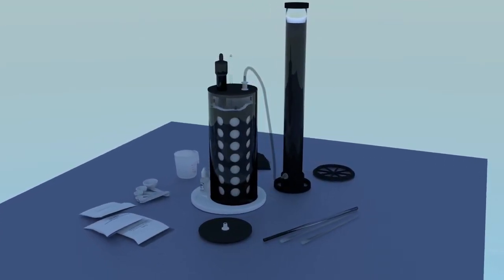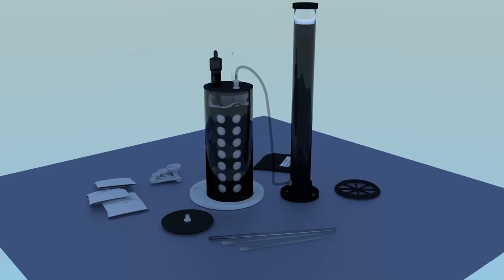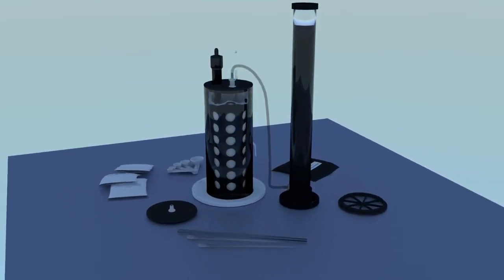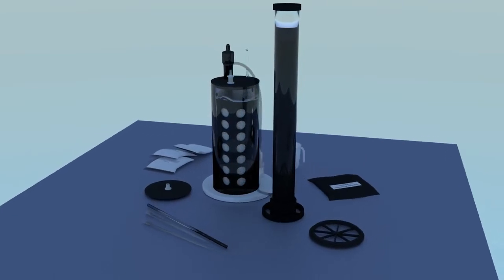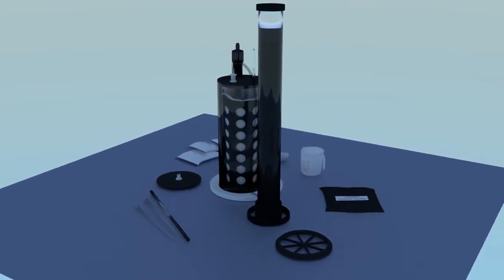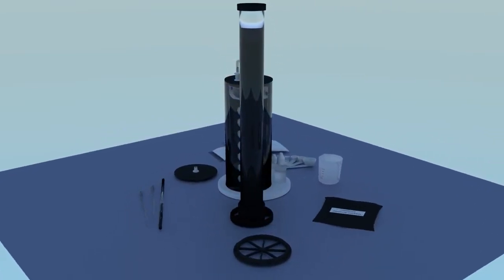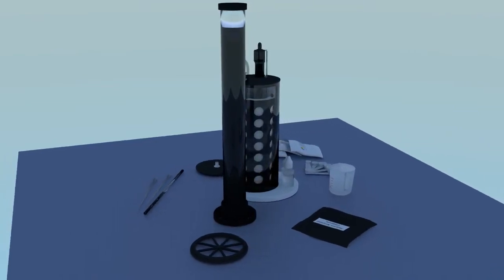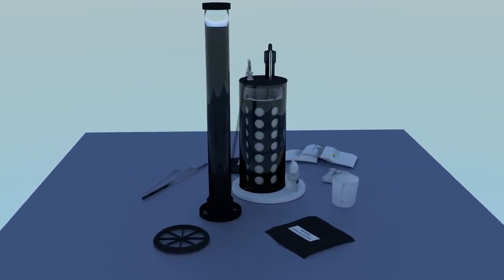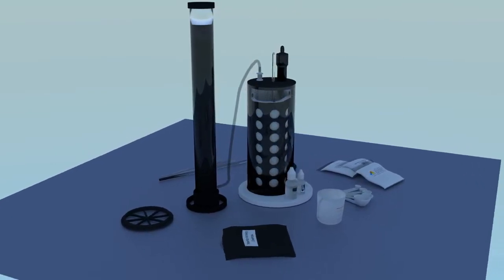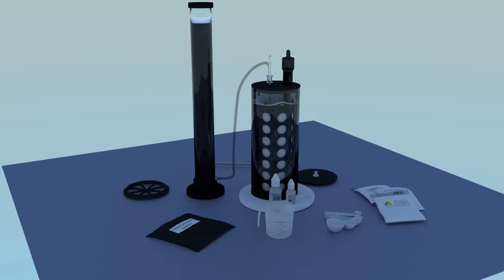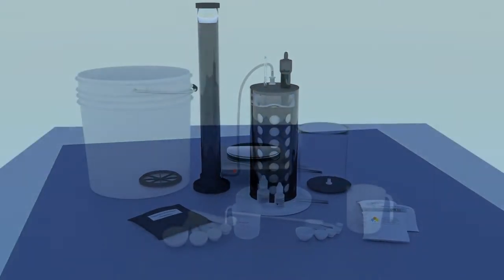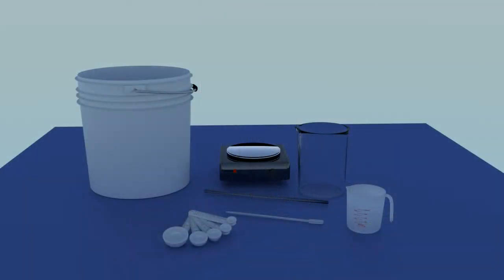Even when working with environmentally safe materials such as MX3 dissolving agent and quadratic precipitant, you must still use hydrochloric acid. The acid fumes need to be contained to prevent corrosion of your tools and your lungs. Therefore a sealed system with a built-in fume scrubber is quite necessary when refining indoors. If working outdoors, you can use ordinary buckets or jars.